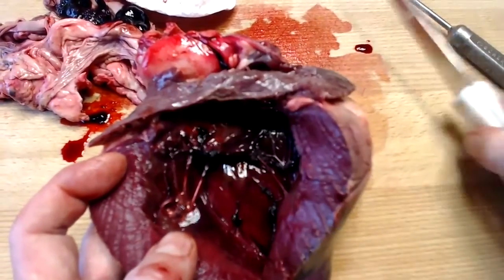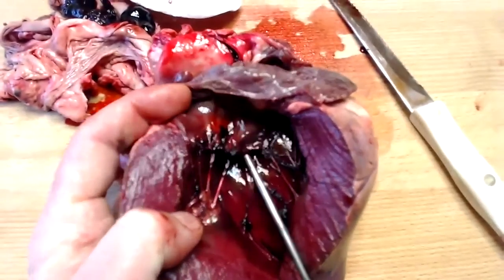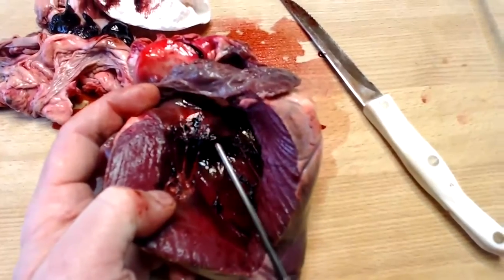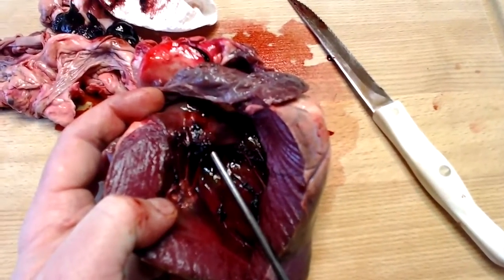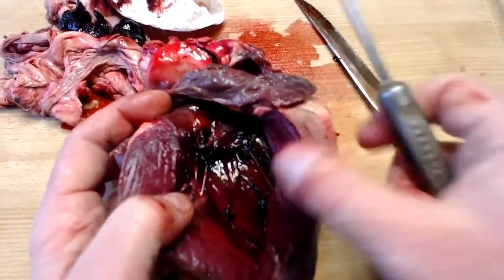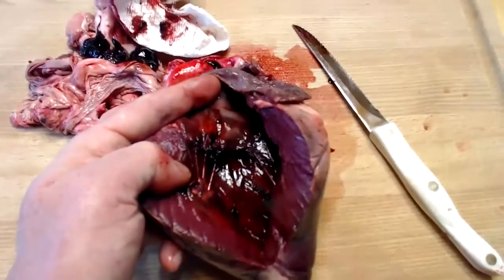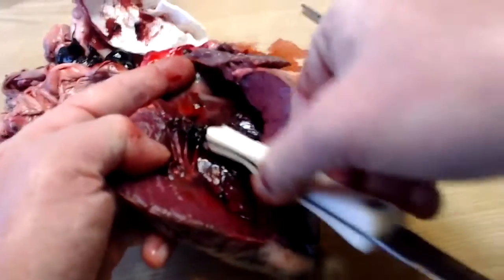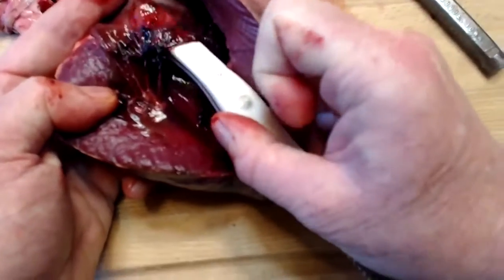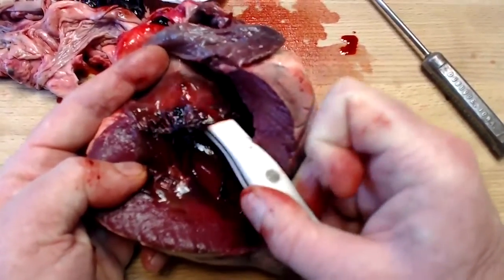Very strong fibrous cords. These are going to be attached now to another AV valve, atrioventricular valve. This is the bicuspid. Remember, on the right side, between the right atrium and right ventricle, we have the tricuspid. On the left side, we have the bicuspid. There can be two cusps. And we can see one of them right here very nicely underneath the handle of my knife. See it? See the knife just through that rather thin but yet strong cusp.